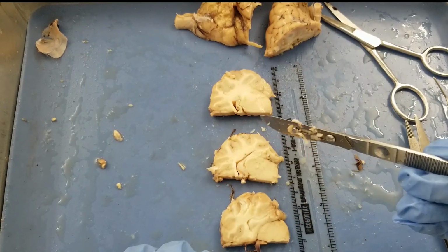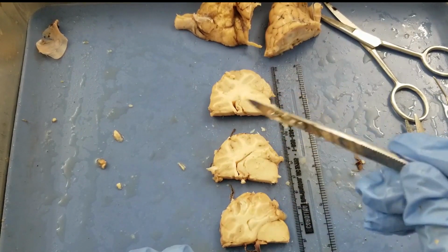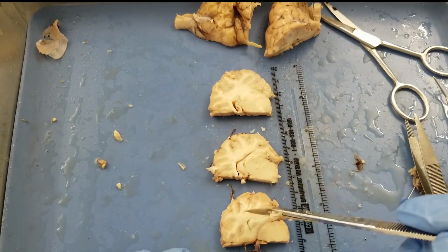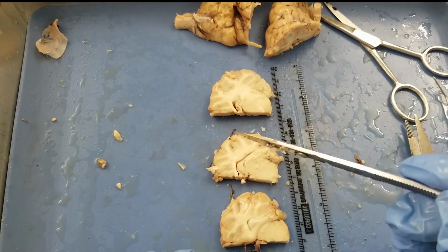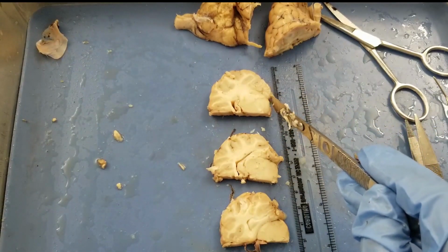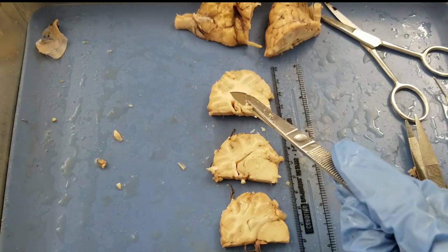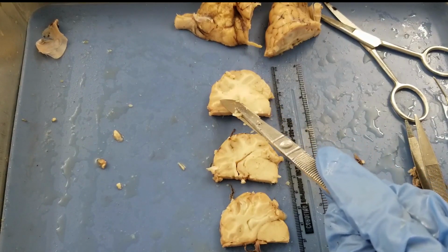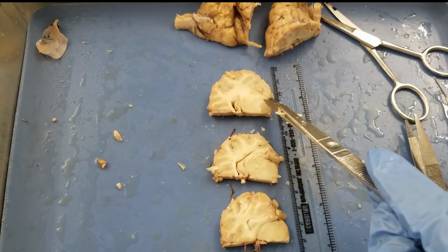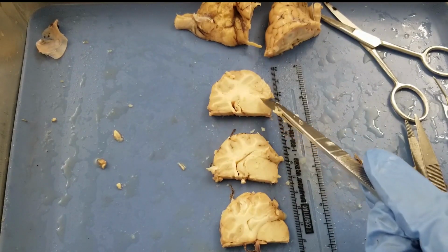Okay, now let's place, in the lab manual it says place the rostral slice away from you. This is away from you. And for each slice, you have to place the ventral side closer to you. So this is the ventral side. Why? How can I tell? Because there are more textures in here. This is a cortex, and this one doesn't have much structure. That's the ventral side of the brain.